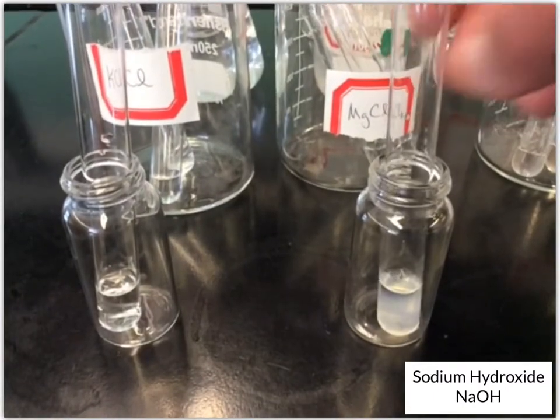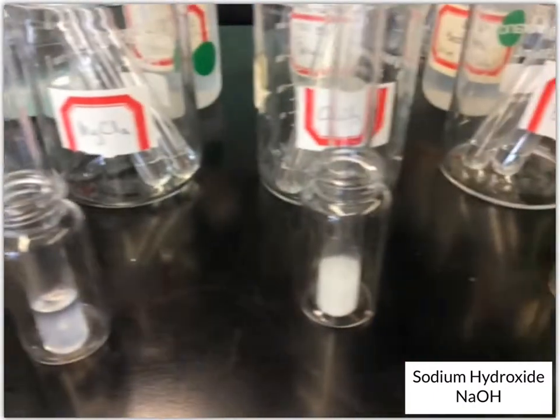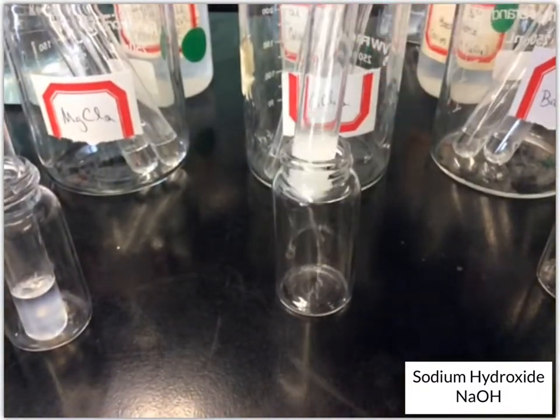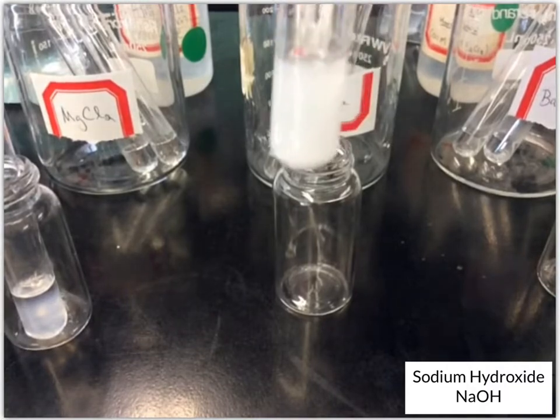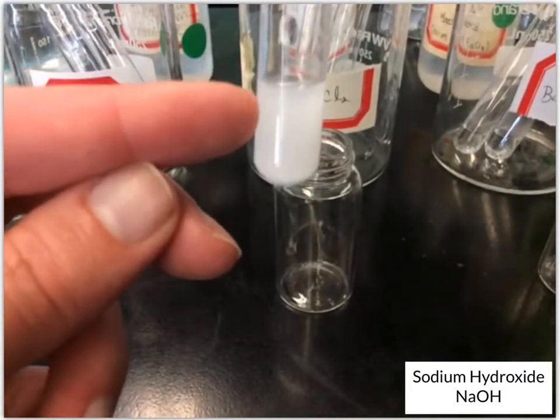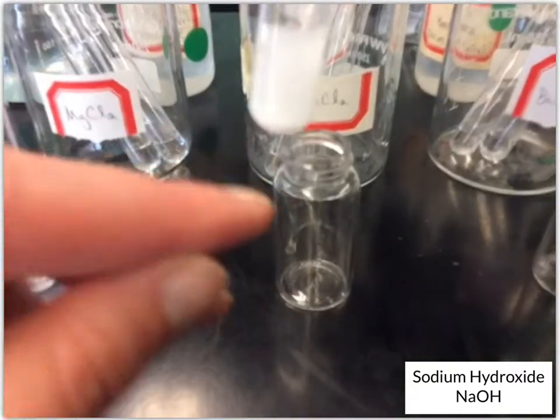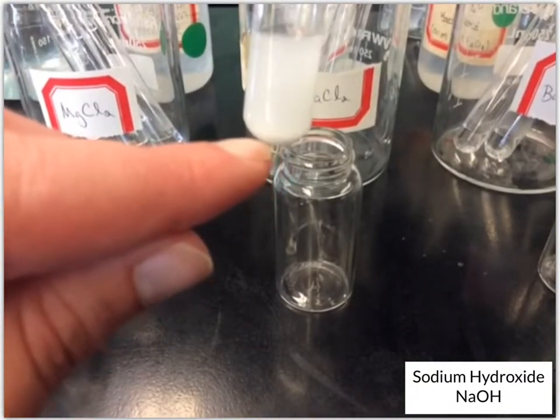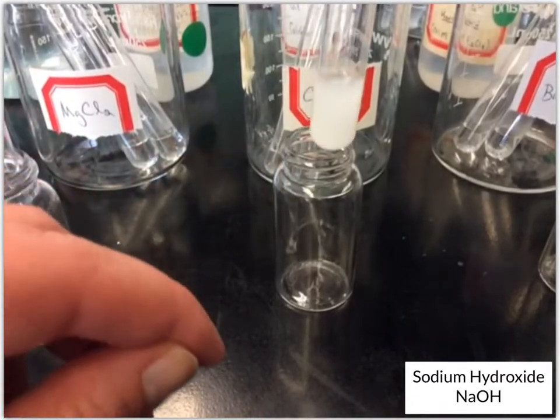And so yes, we definitely have some precipitate in there. Next up, we've got the calcium chloride. Now this one, you can't see it clearing up at the top, but you can see some solid that has started to settle here. So you definitely have some precipitate there.